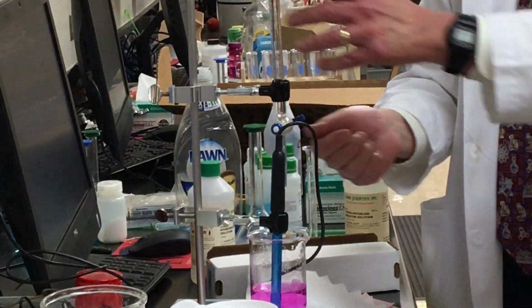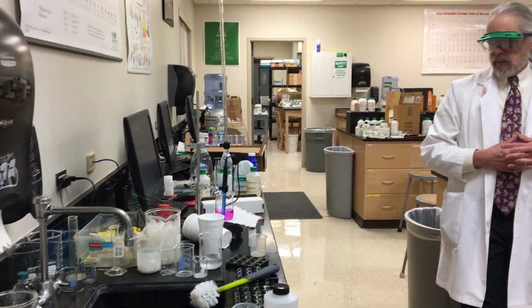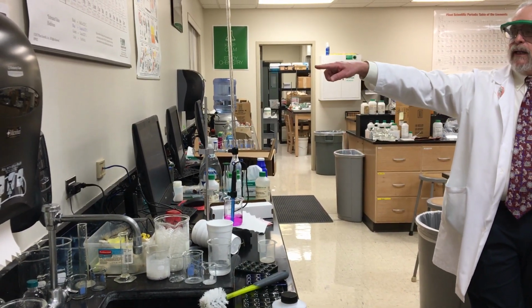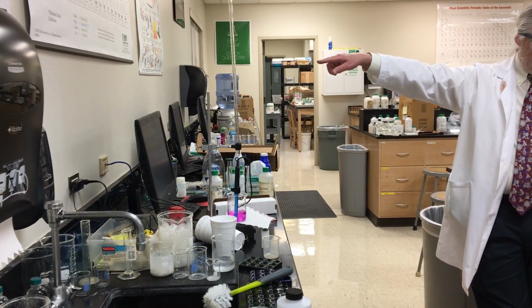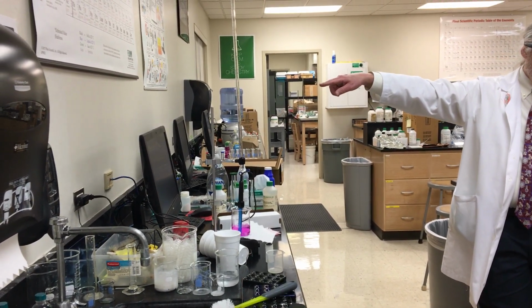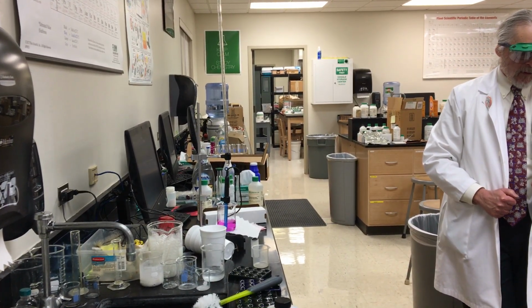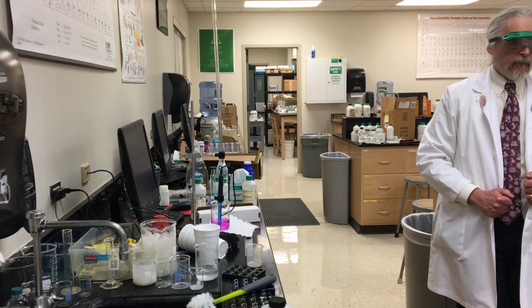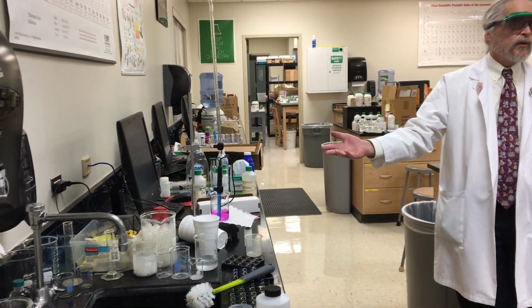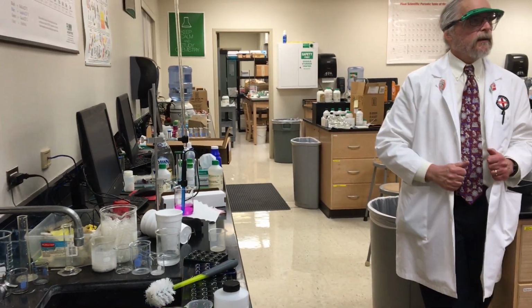Okay, now, time out. Real world time. True or false? I could put the acid in the beaker and the base in the burette and do a titration? Assuming that the base was your unknown, yes. Could I put the base in the beaker and the acid in the burette and do the titration? Yes. I could put either one either place. Now I've got to be really careful about measuring my volumes, okay, but as long as I measure my volumes correctly, all I need is acid in one and base in the other, right?